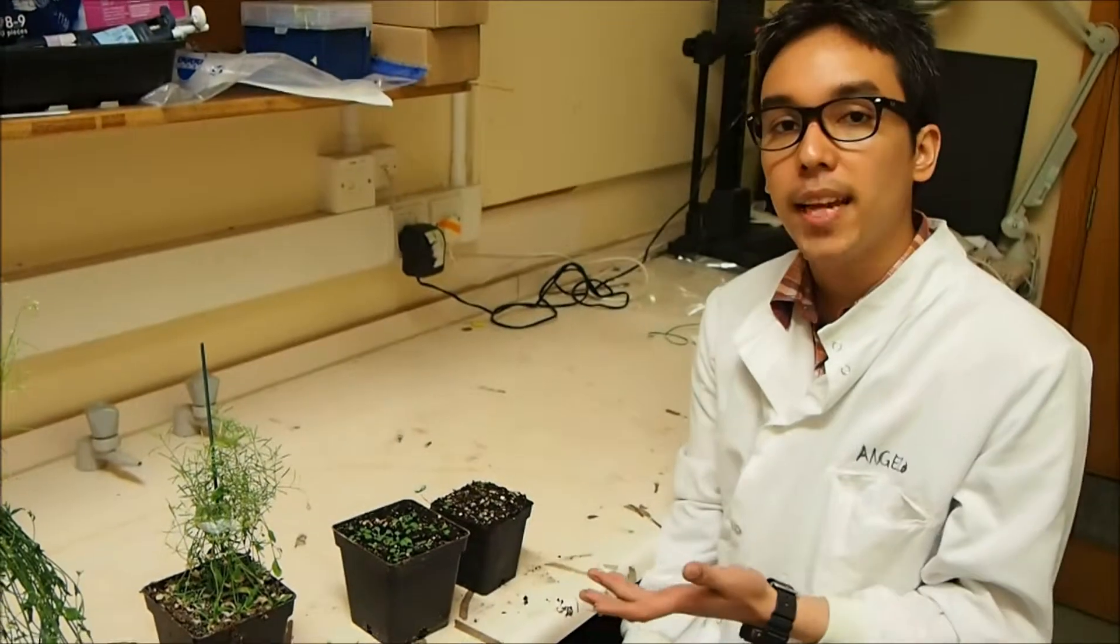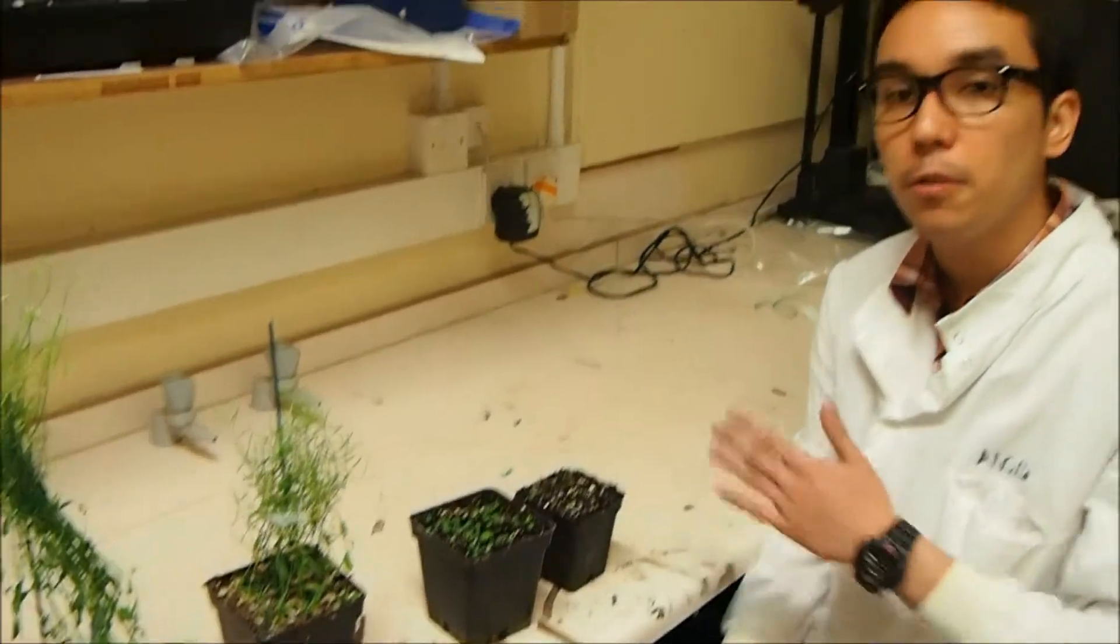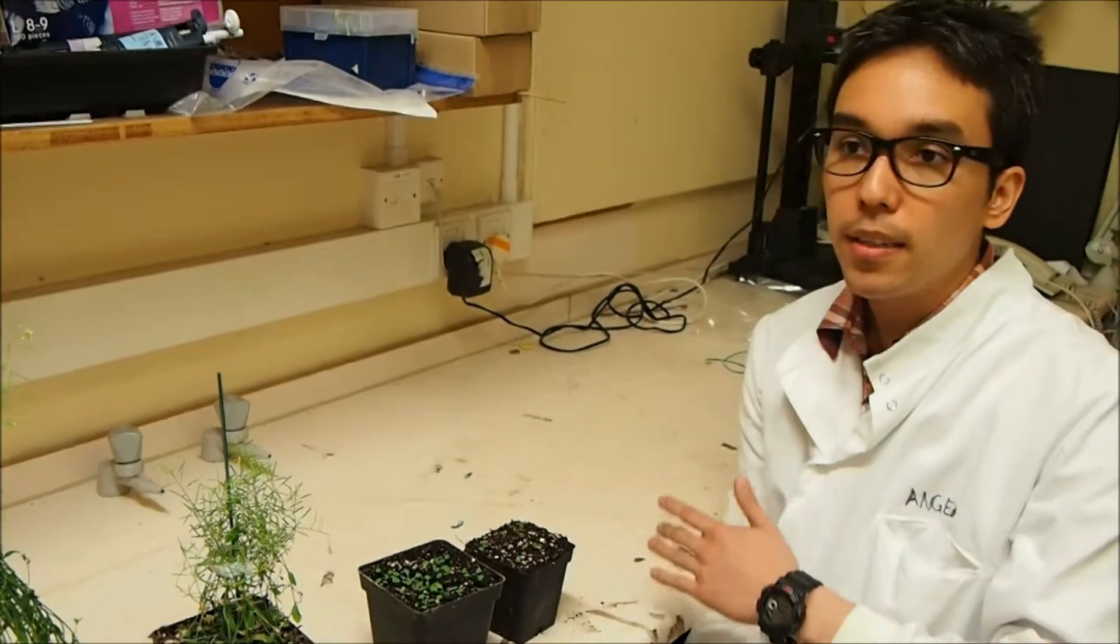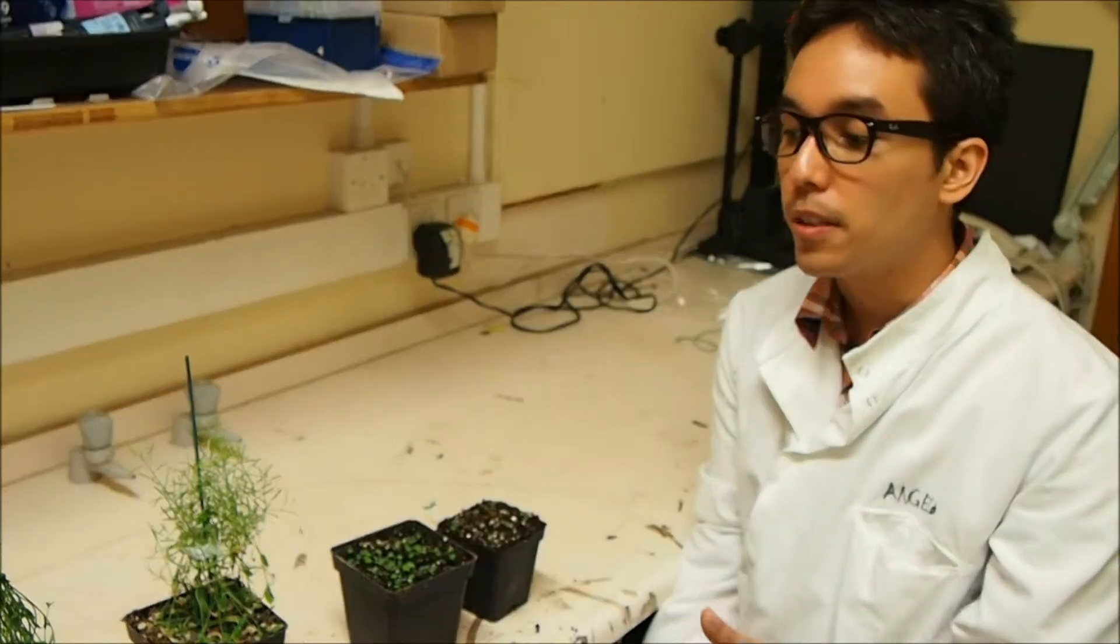And there you have it. After you've planted your seeds in your pot, this is generally how it will look throughout its stages: in a week's course, in two weeks' course, and in two months' course as well.